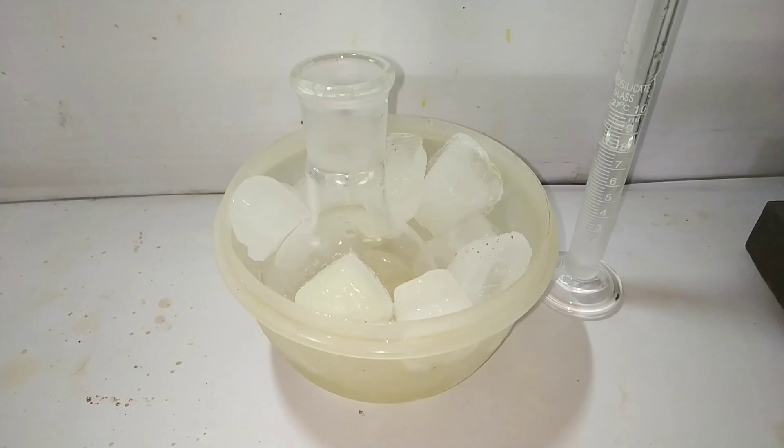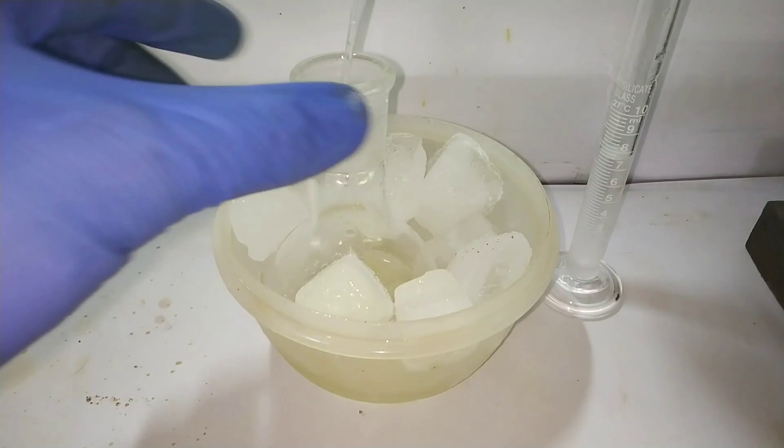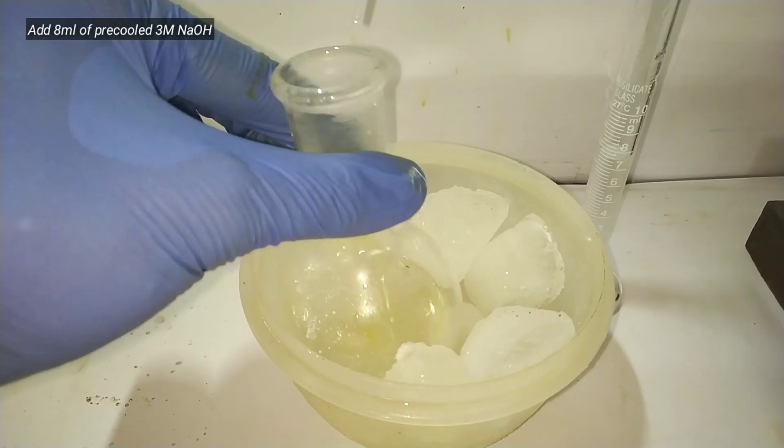Now with the help of a glass dropper, slowly add the sodium hydroxide solution drop by drop into the cooled flask. Agitate the contents of the flask vigorously while adding the base.